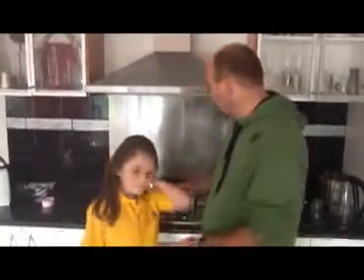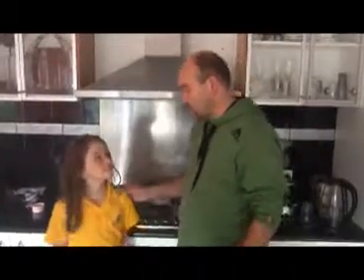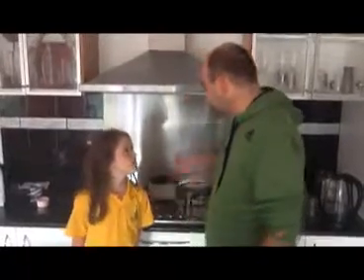Ready? Okay. This is our experiment, Adam and Simon's experiment, and Chloe's going to help us. This is our experiment on what happens when you heat salty water. So we've just put 50 grams of salt into 250 ml of water. Adam and I both have previous knowledge regarding this experiment, but Chloe's never done it before. So we're going to ask Chloe to make a prediction, have a look what happens, and then we're going to explain it later on. Okay.